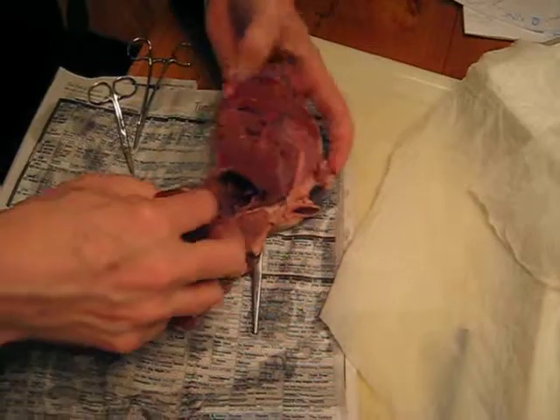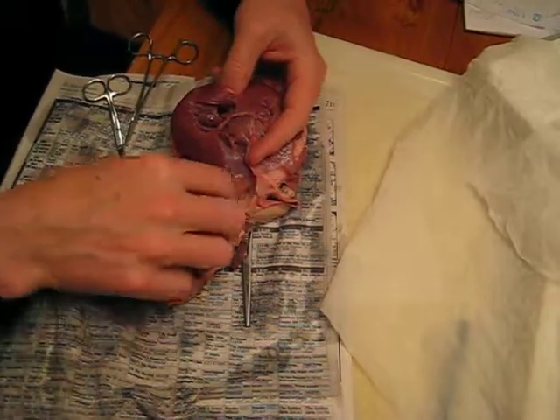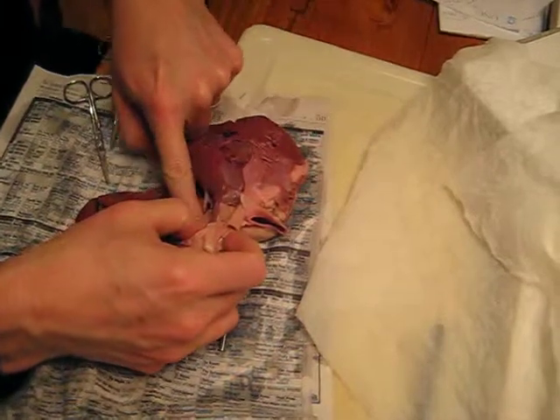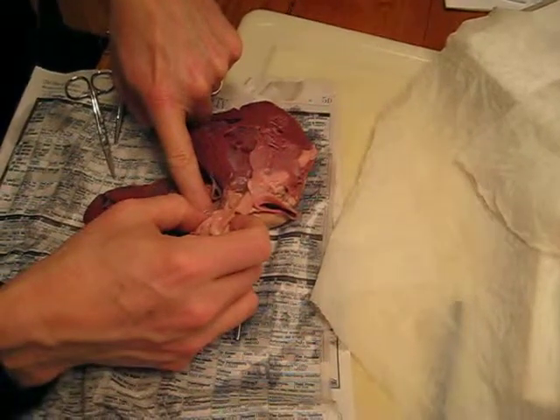But you have this thin-walled chamber — look how thin-walled that chamber is. Remember, if this came together, you'd be left with that little tiny chamber, this thin-walled. That's your right ventricle. If you look up above that, that's the valve between the right atrium and the right ventricle. That's what closes during systole, so the blood doesn't go back out into the vena cava.